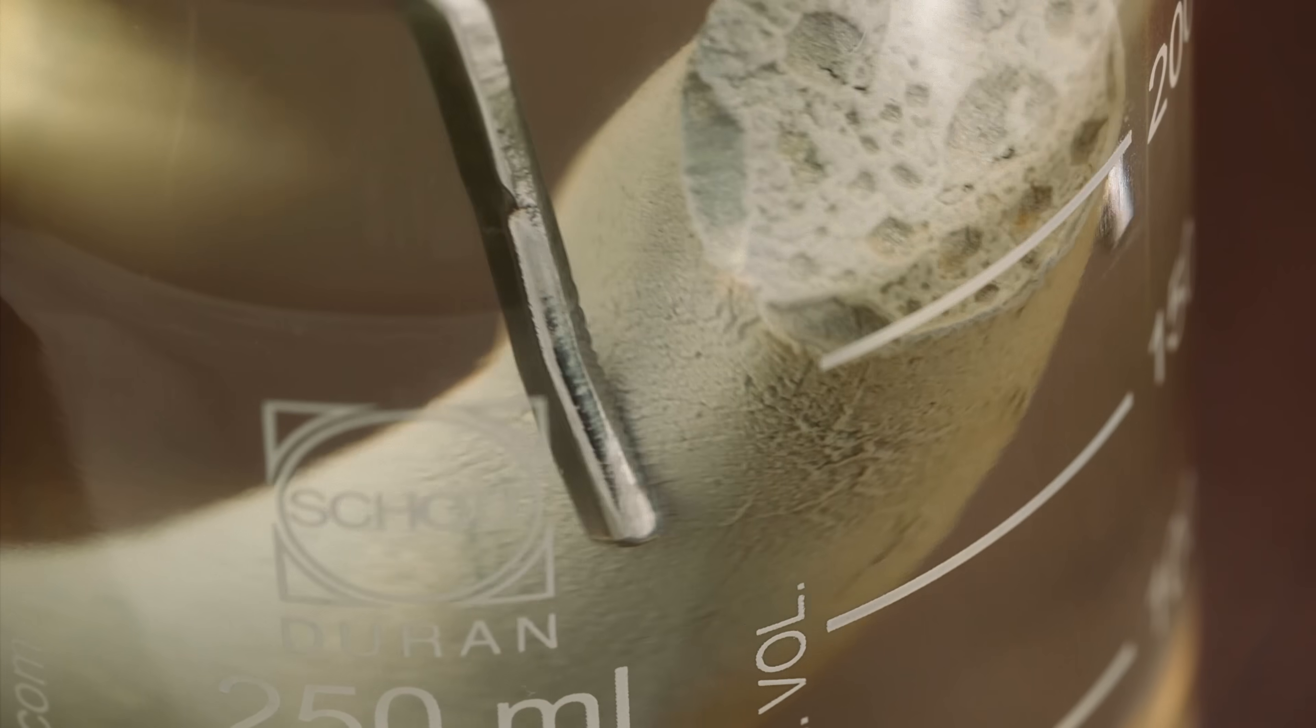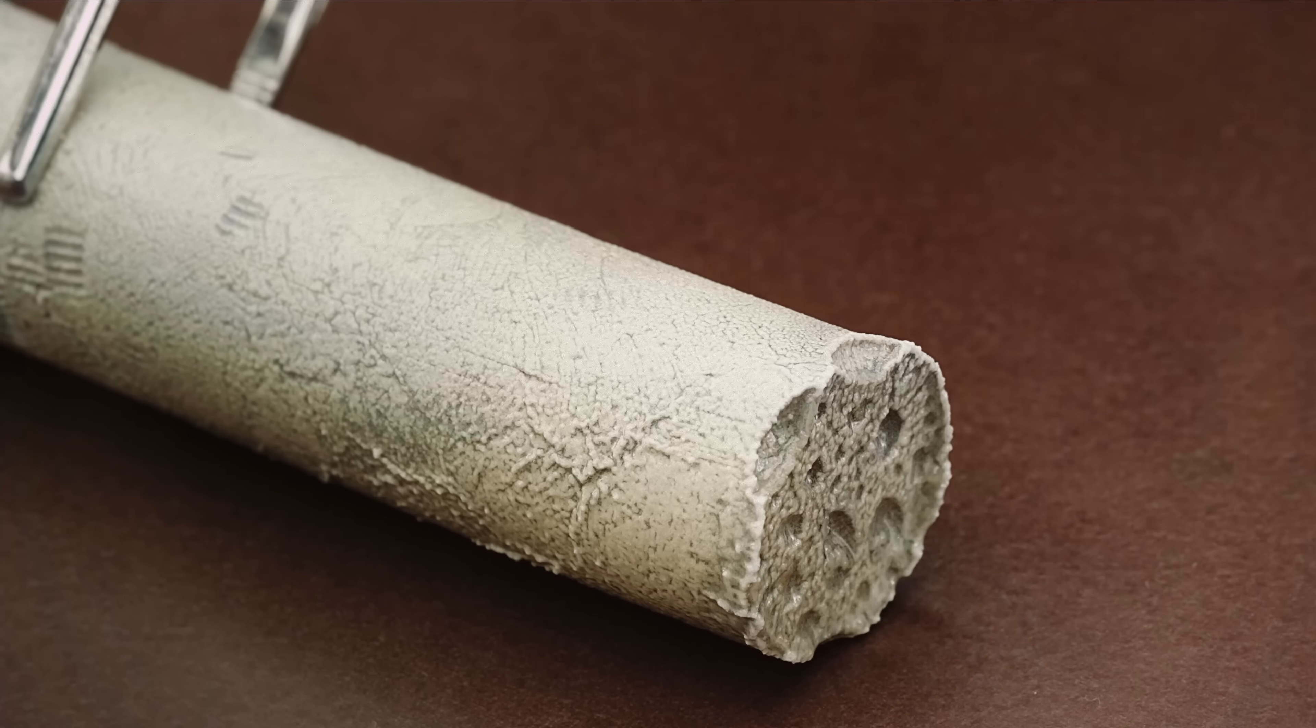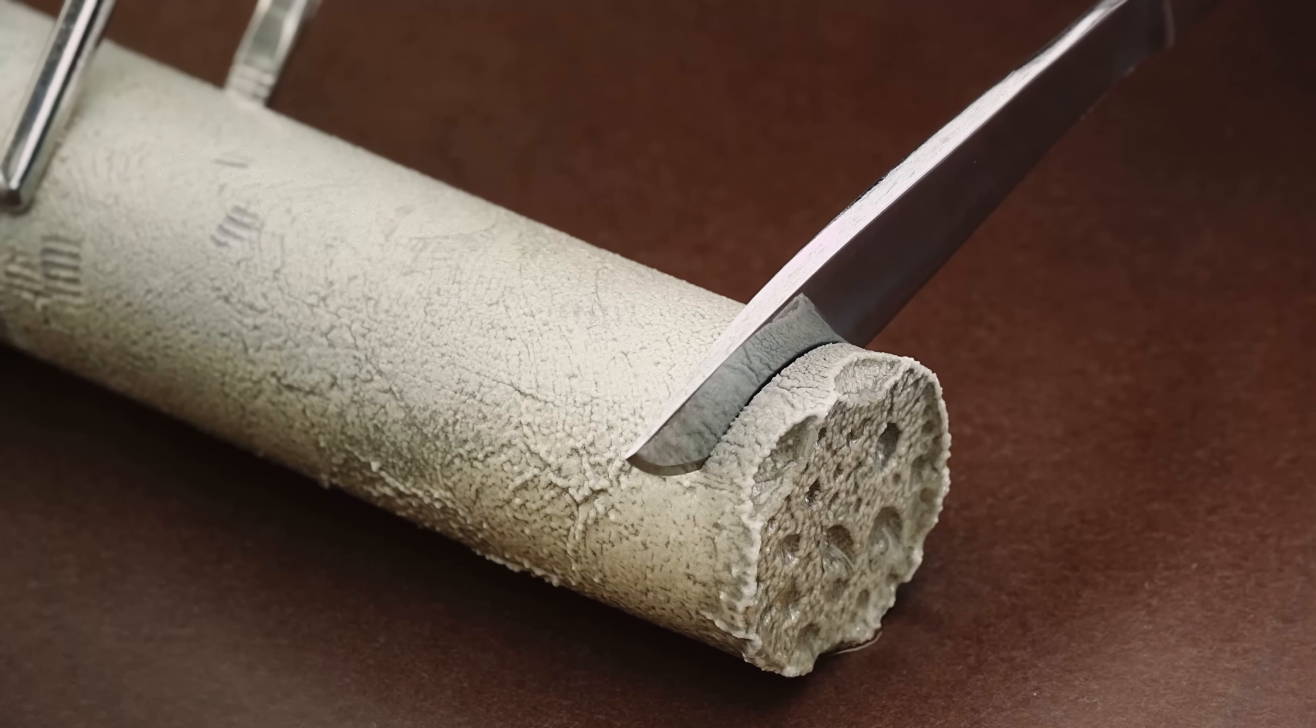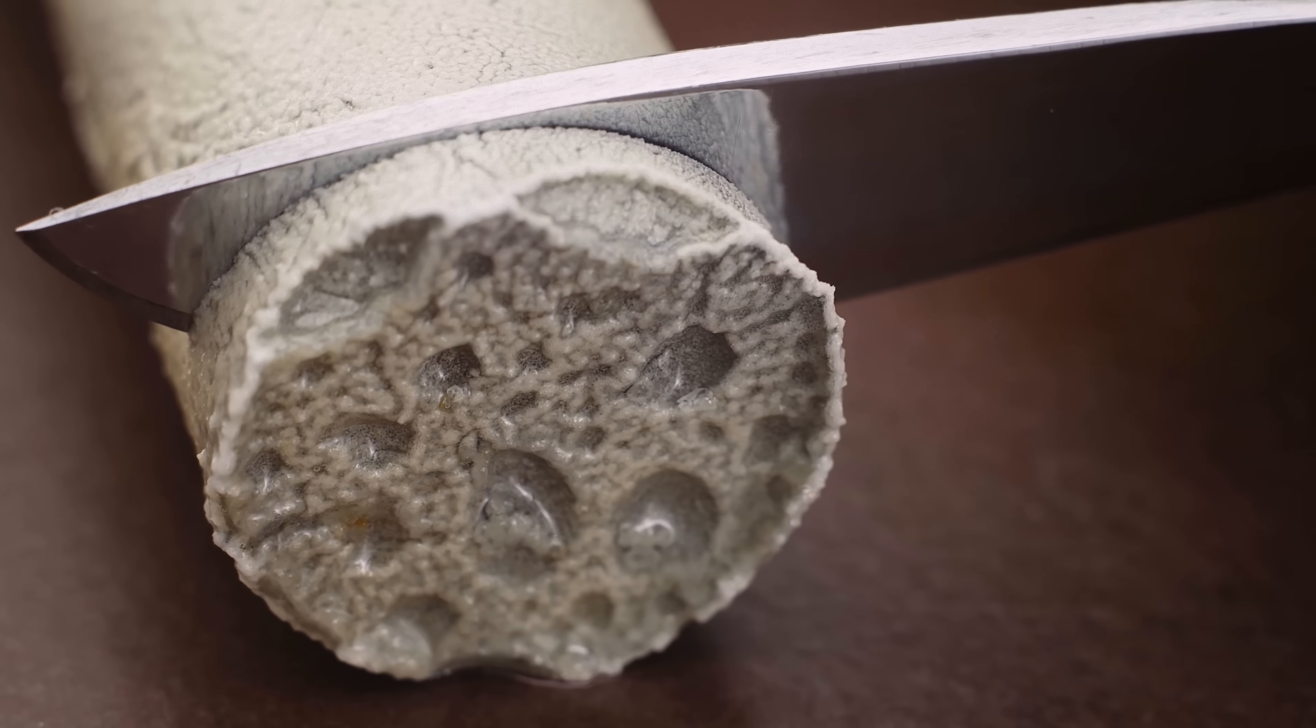Hey guys! When alkali metals are placed in water, we are always on the brink of exploding. In this video, I'll demonstrate how we control this vigorous reaction to prevent explosions.